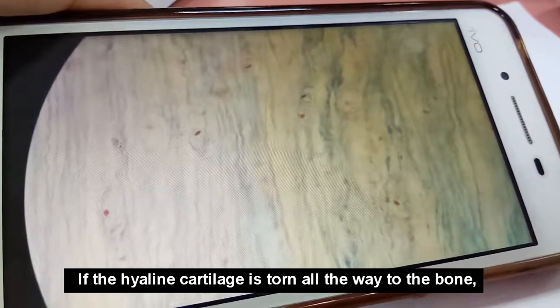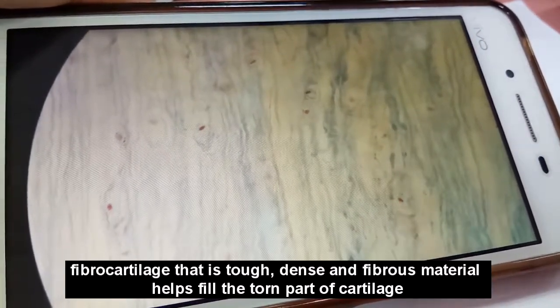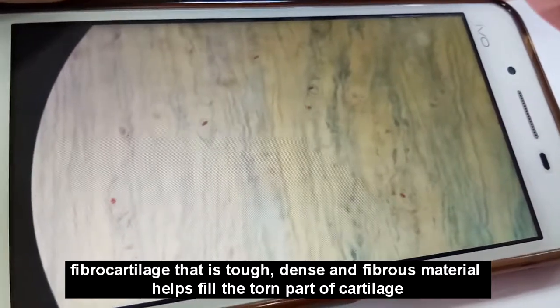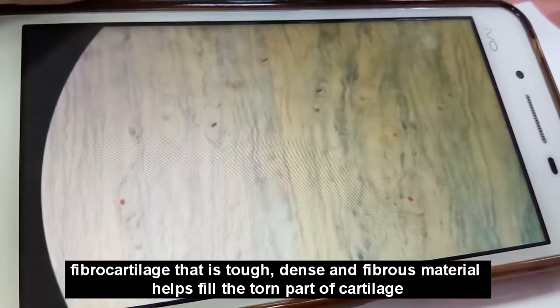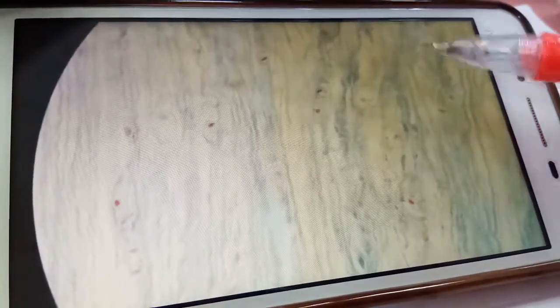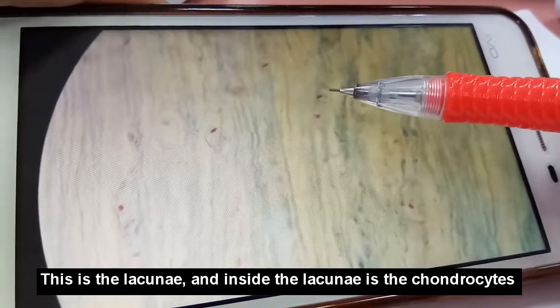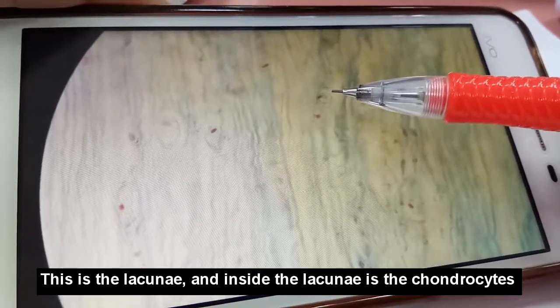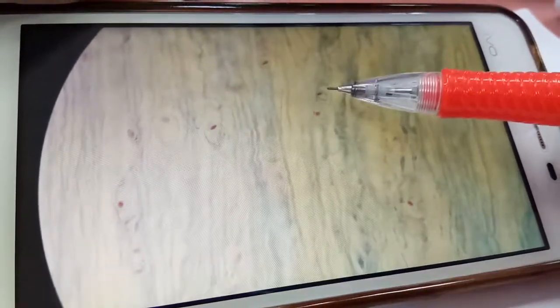If hyaline cartilage is torn all the way down to the bone, fibrocartilage, which is tough, dense, and fibrous material, will help to fill in the torn part of the cartilage. So, as you can see here, these are the collagen fibers, and this is the lacuna. And inside the lacuna, there is the chondrocyte here.